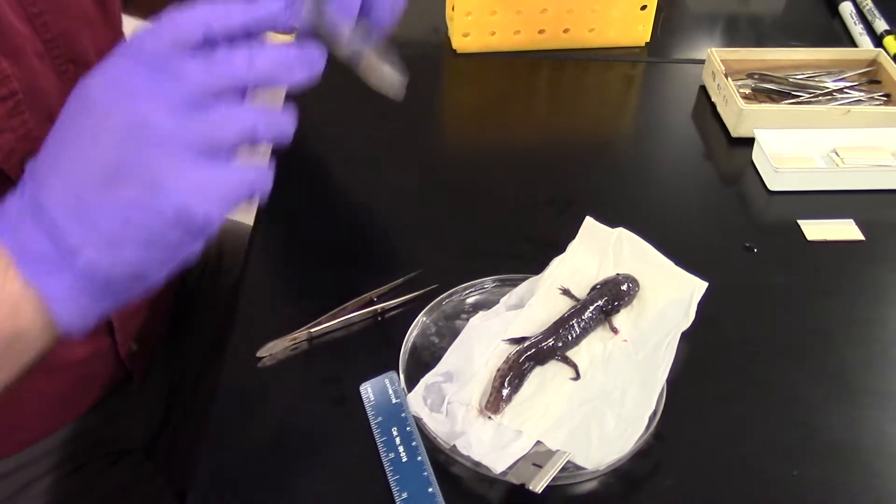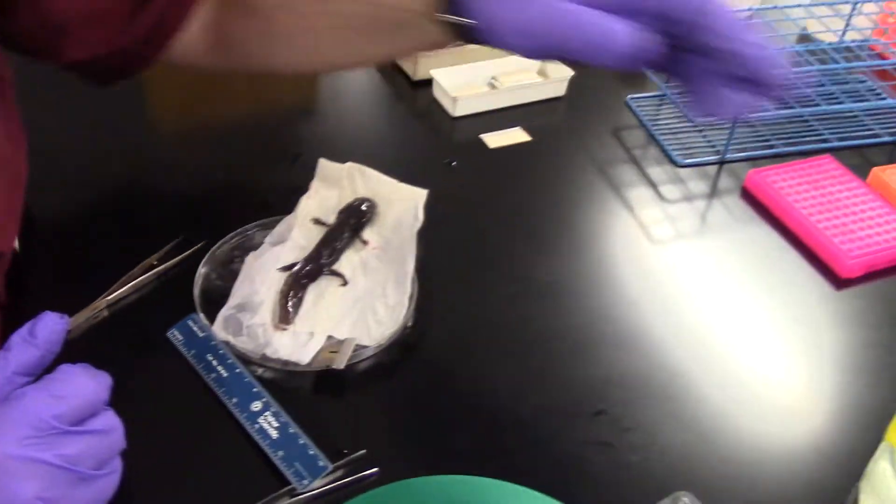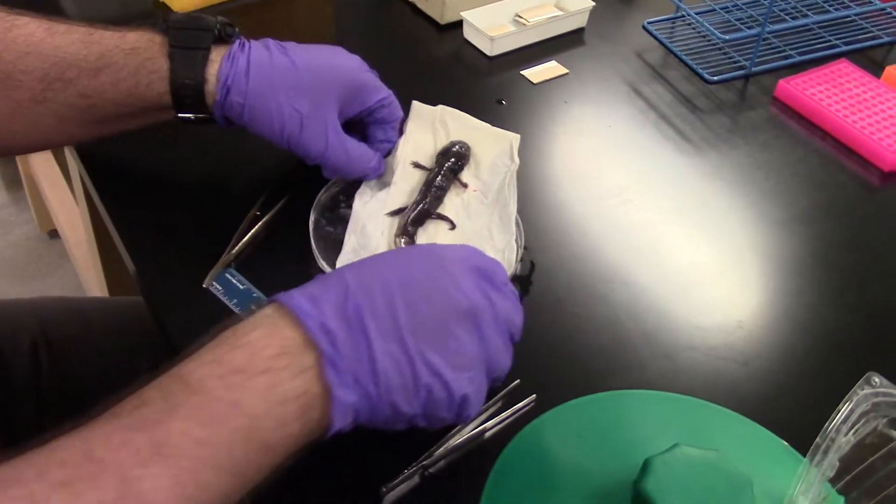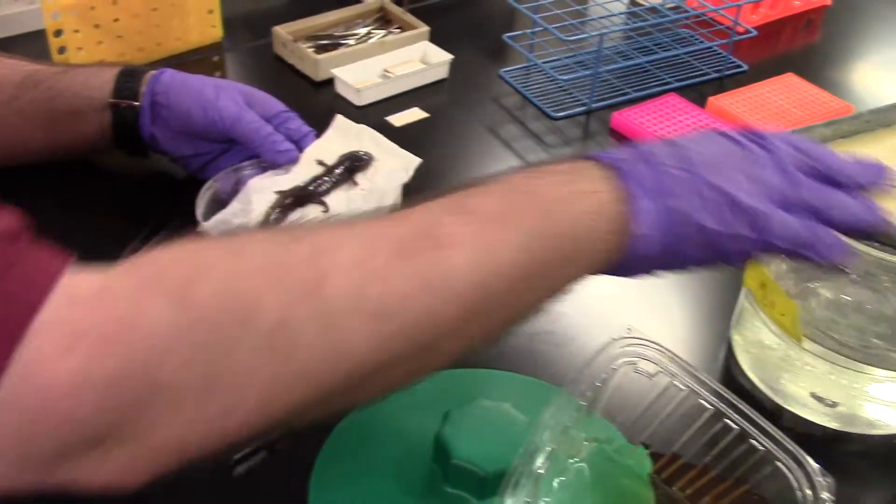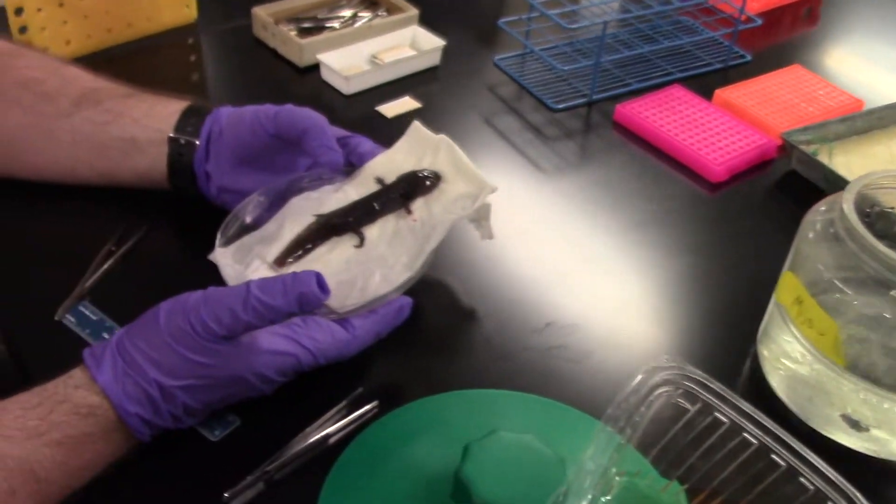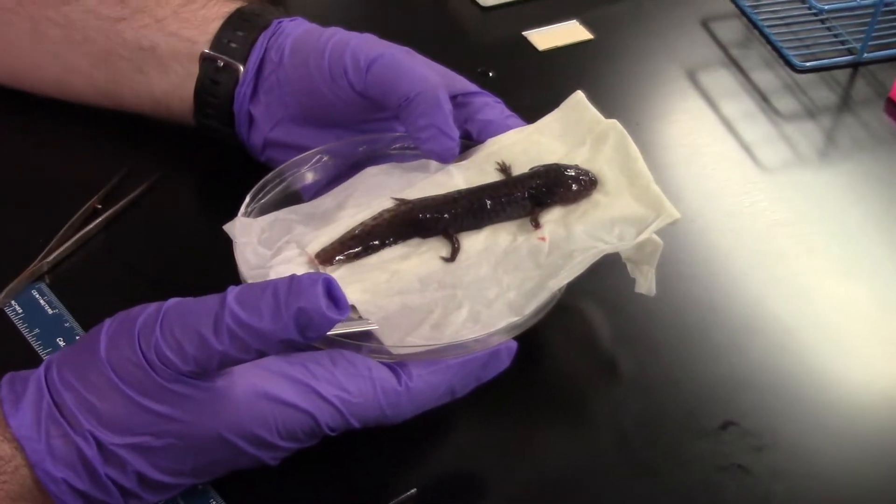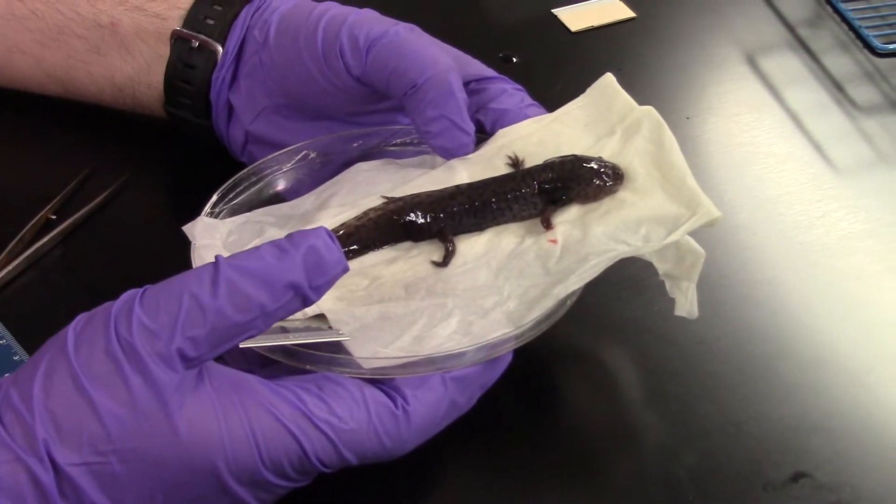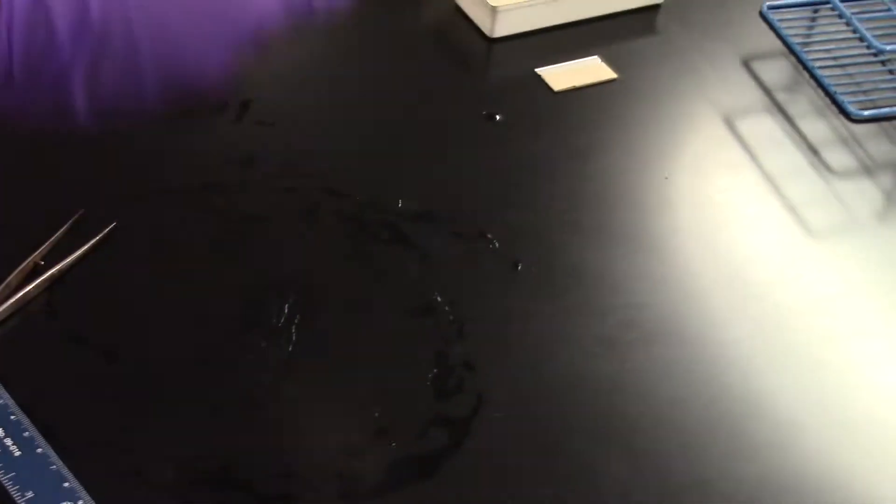And our buddy here, Mijo, is ready to go back into his container. Did you want us to try to see it under the microscope? Yeah, okay, let's put it under the microscope first.